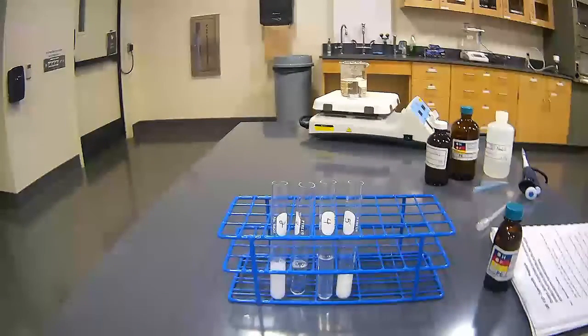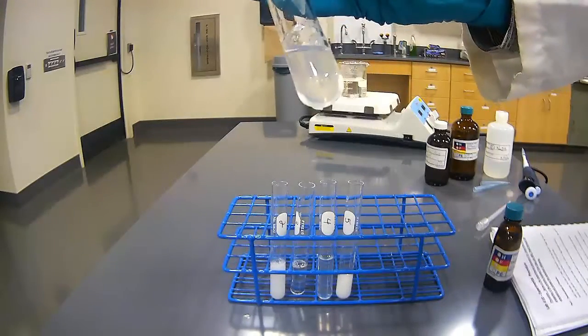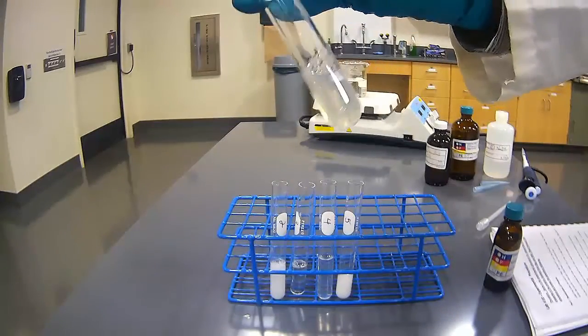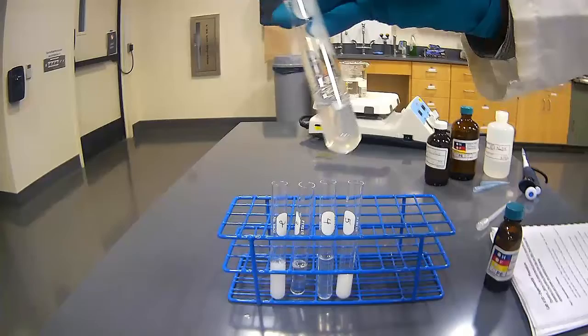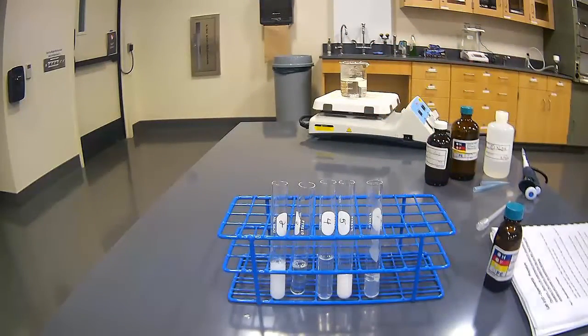There also appears to be a little bit of stringy matter. The bubbles have some additional strings that are associated with them. So there are our 5 test tubes and what we've done to show differences in protein behavior.